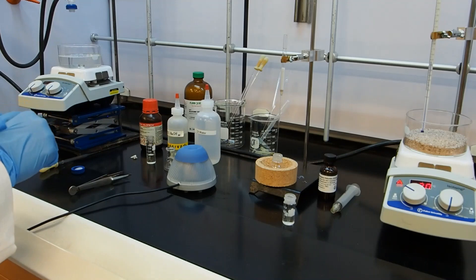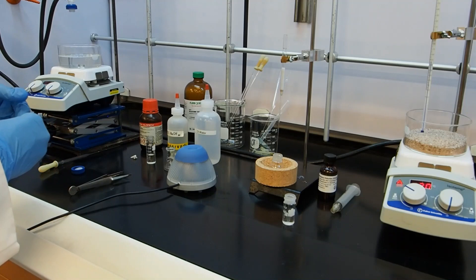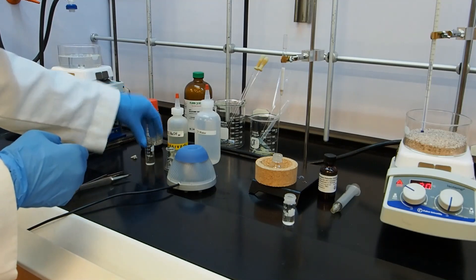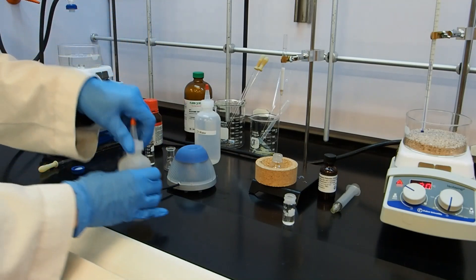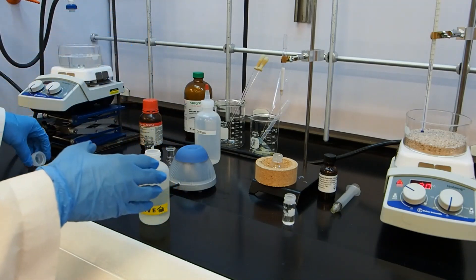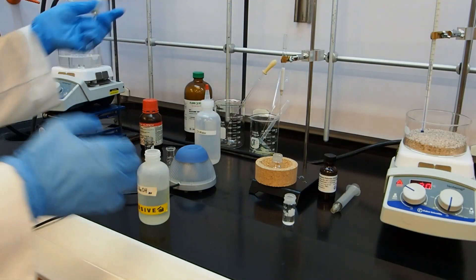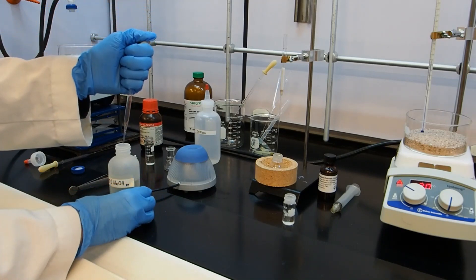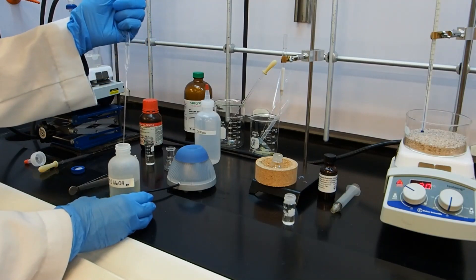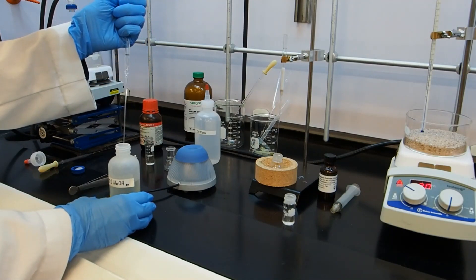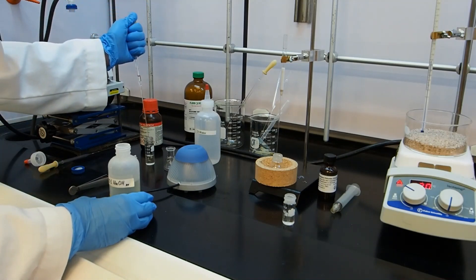And if you're never sure, you can add a couple of drops of ether or water and see what happens. So I have my ether layer here. I've got my sodium hydroxide here. 400 microliters is about half a mil, a little less than half a mil. When you're doing extraction, some of these volumes don't have to be exact. So I'm going to suck up about one mil and squirt half of it out. That's probably good. And I'm going to add that to my ether layer.